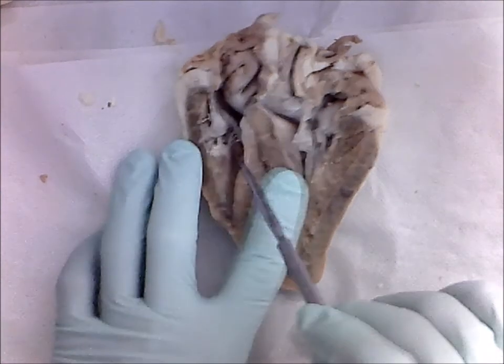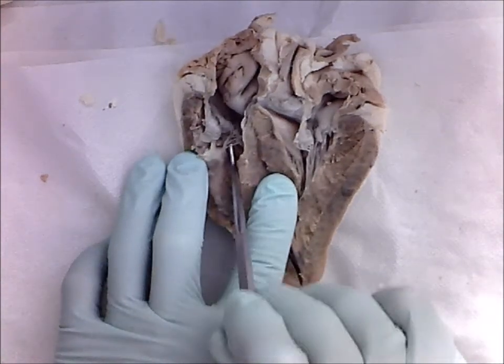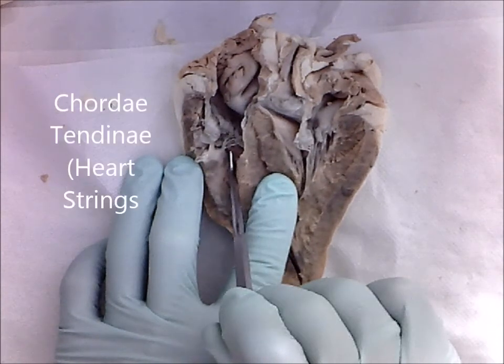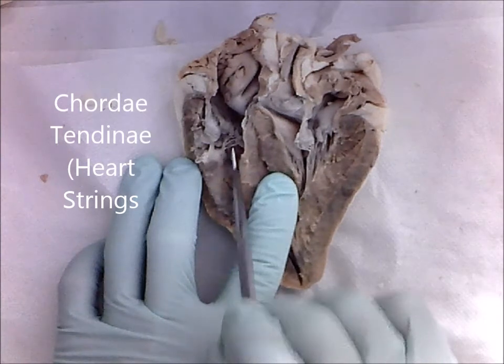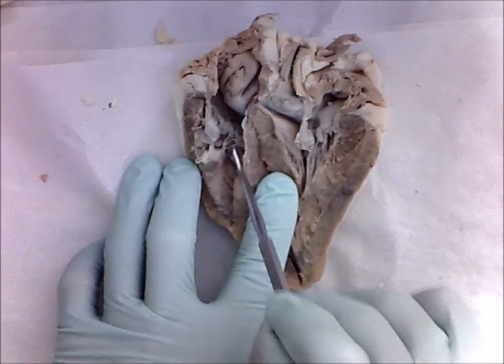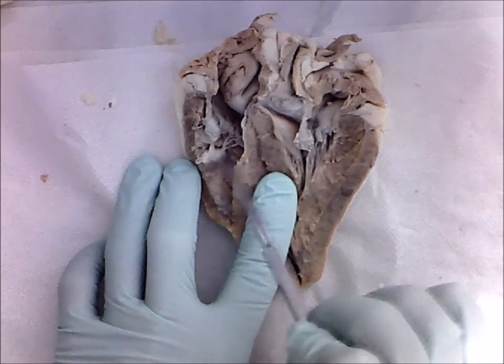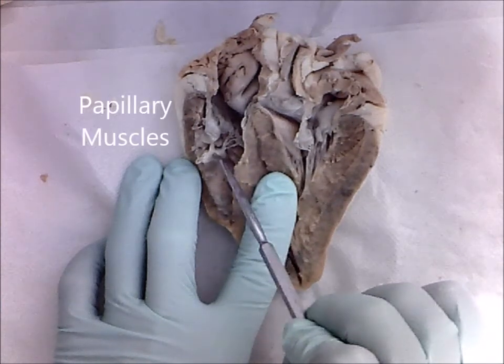So let's go back and take a look at the valves. The strings that are attached to the valves are called chordae tendineae, heartstrings. The heartstrings are attached to the inner wall of the ventricle through structures called papillary muscles.